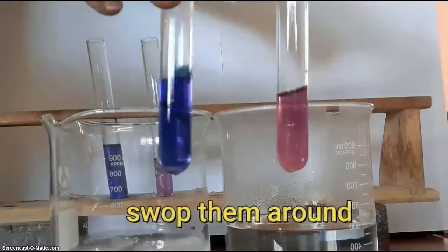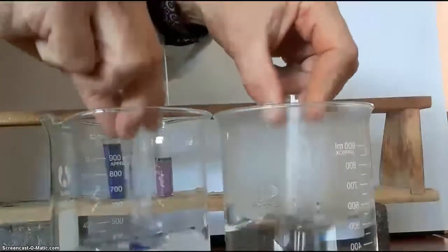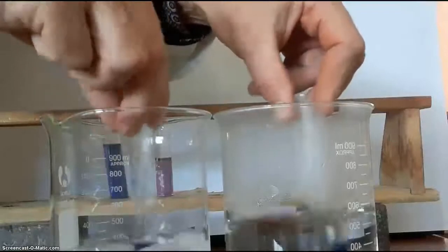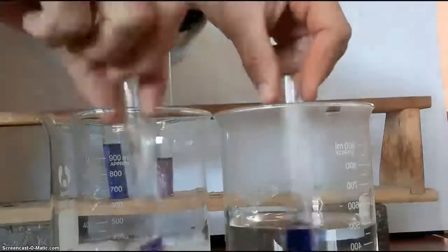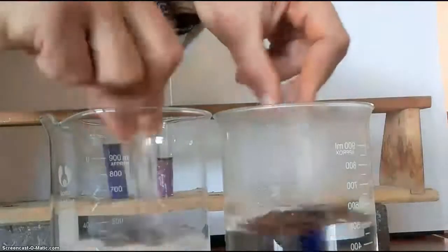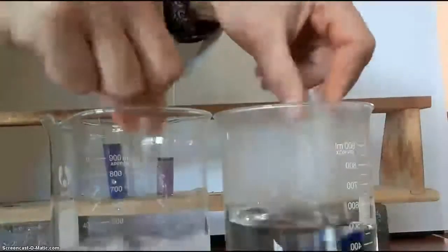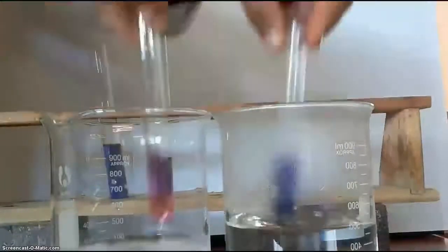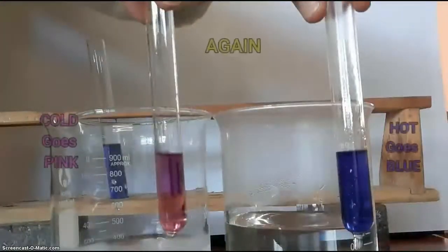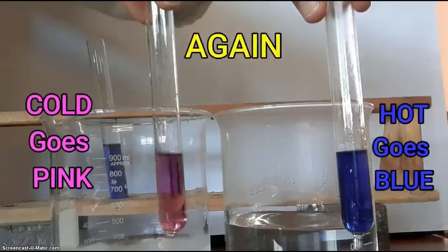So let's swap them around and try it again. It takes a bit of time for the liquid in the test tube to reach the temperature of that in the beaker. And again we see the cold one goes pink and the hot one blue.